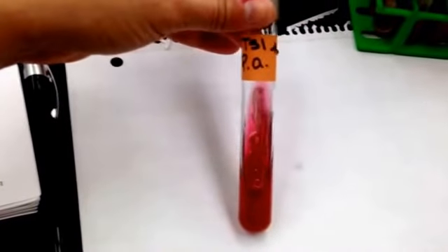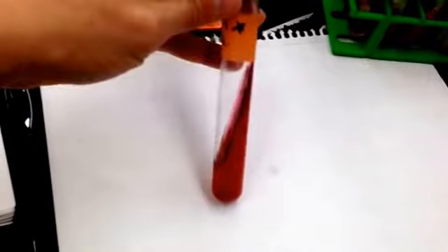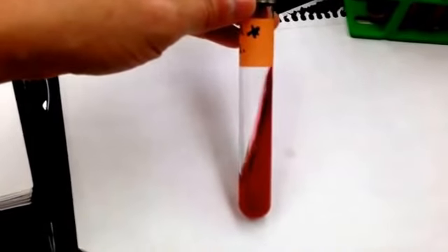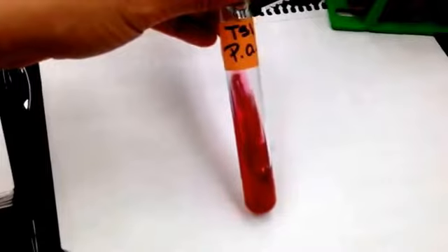And Pseudomonas aeruginosa is pink over pink with no gas. There can be no gas if there is no acid. So this is alkaline-alkaline, therefore there couldn't conceivably be gas. And pink over pink means it did not ferment any of the sugars. There's also no hydrogen sulfide production. The end.